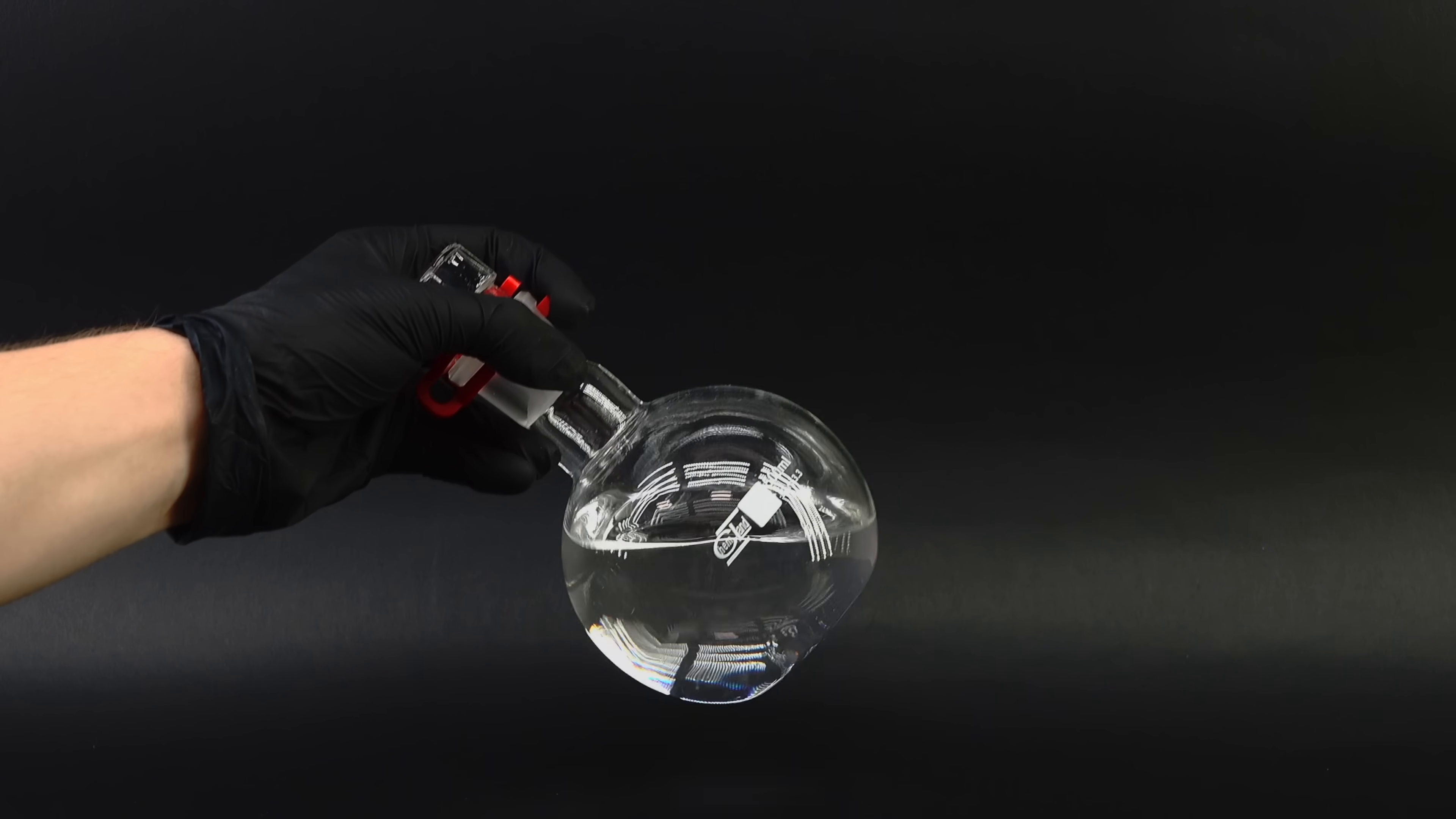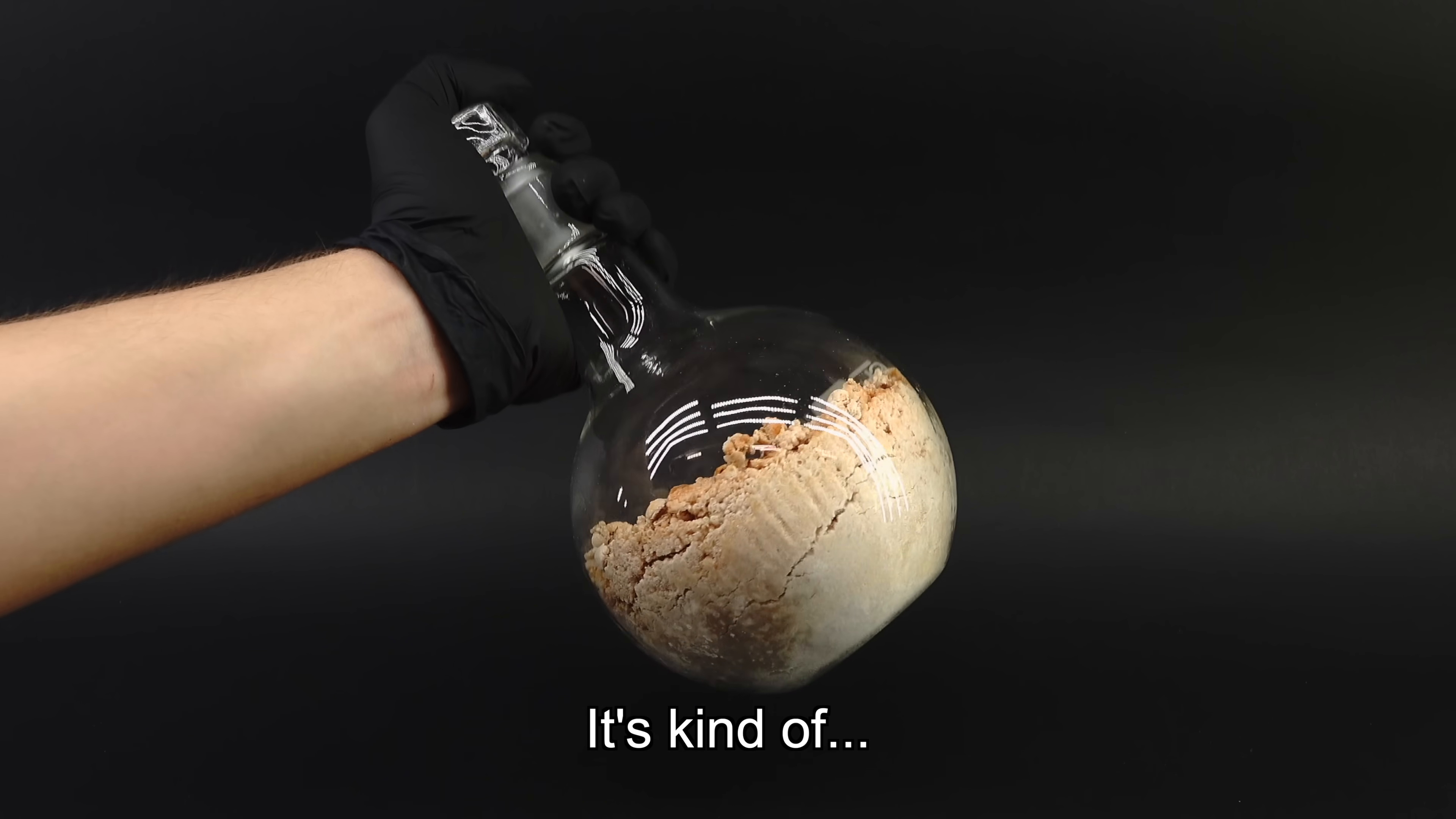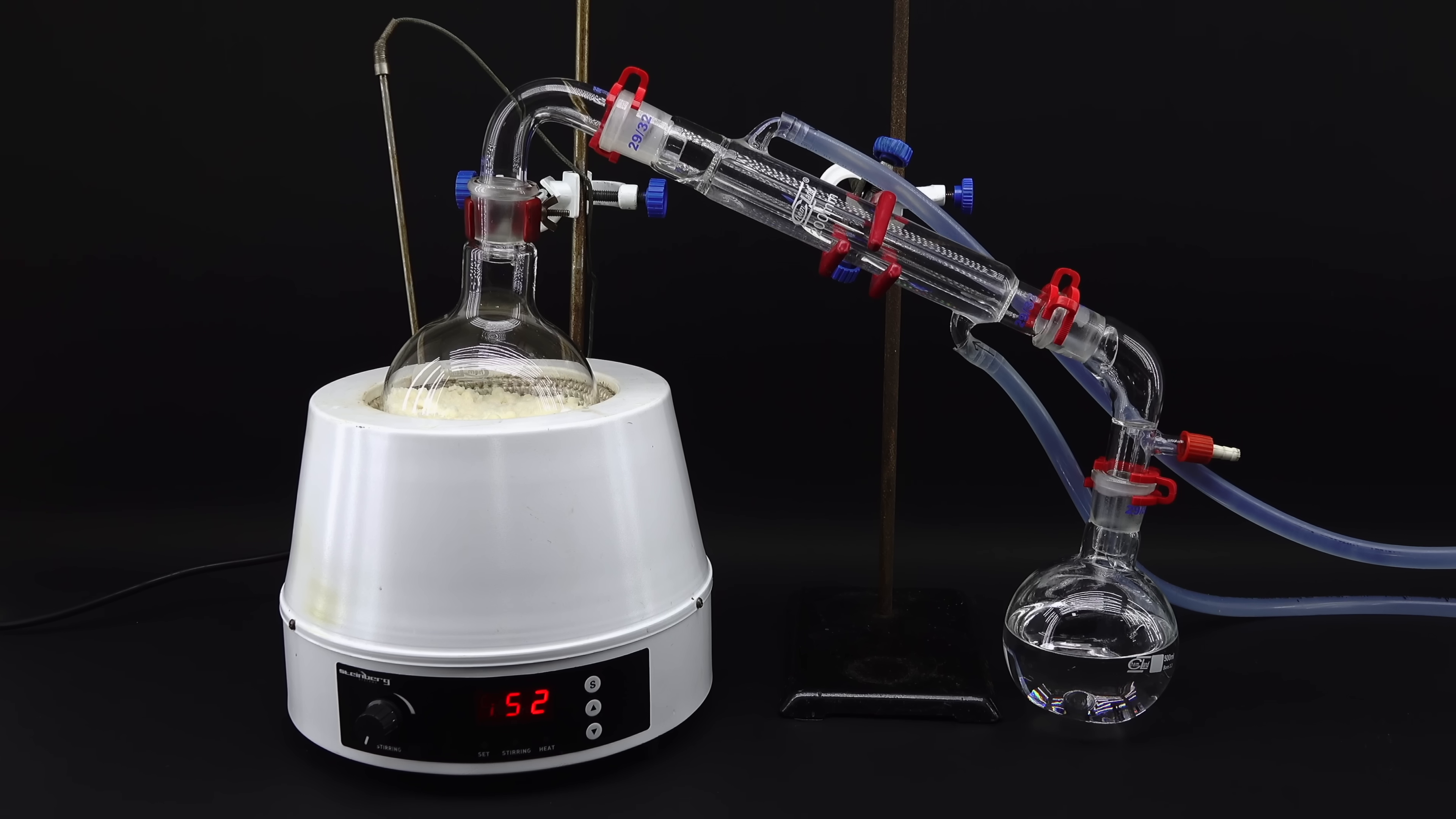Apart from some fine spirit, that's the good stuff, this step left me with something a little more peculiar. I had no idea why it turned out like this, but the sodium acetate was now brown and had an incredibly weird texture. It's kind of crusty. I figured that I am not going to deal with it right now, and instead focus on the overall progress of this project, which, because of the distillation going nicely, was really ramping up.